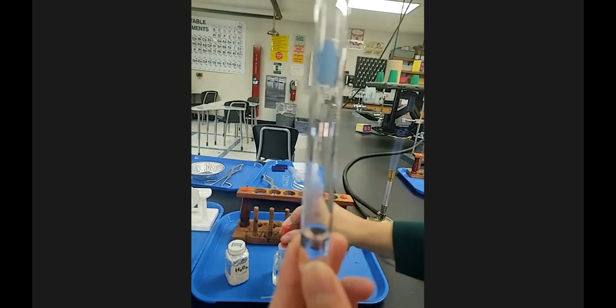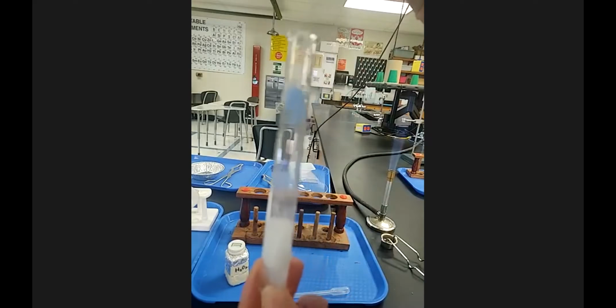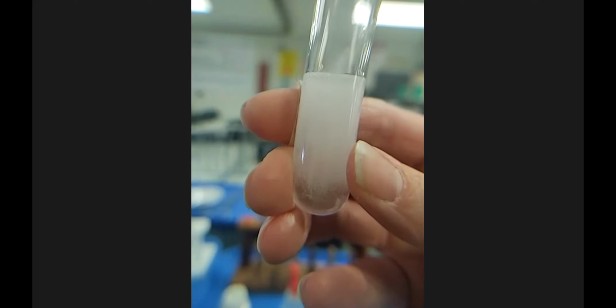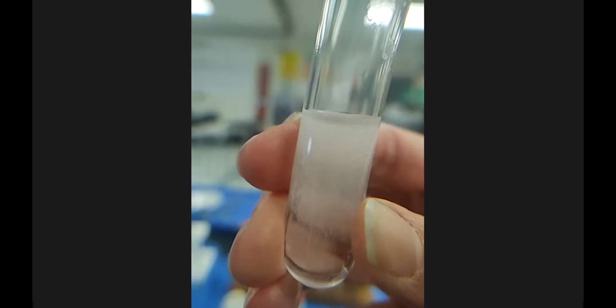So the during is going to be right here when I add the bleach, and I'm going to see that here. There's definitely a fizzing and a bubbling. The test tube feels a little bit warmer. And get you a little close-up of that. Small bubbles forming. The rest of the test tube looks pretty much the same.